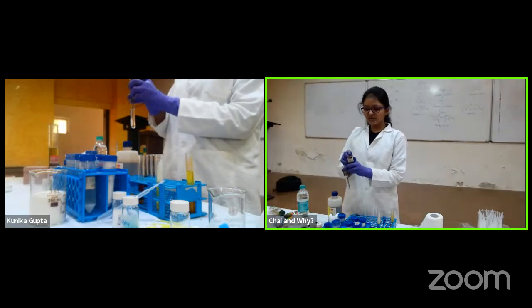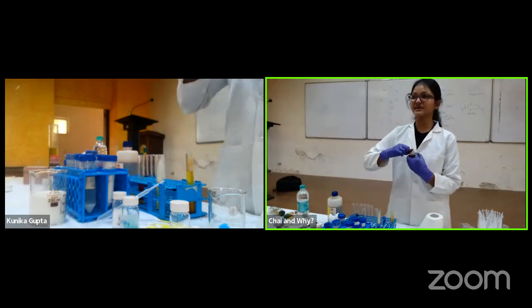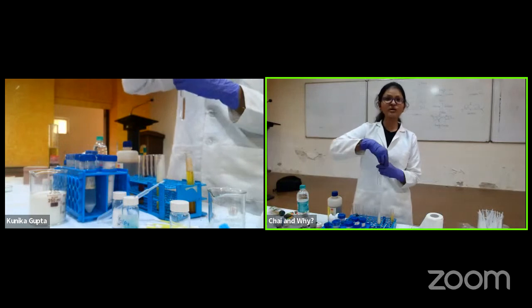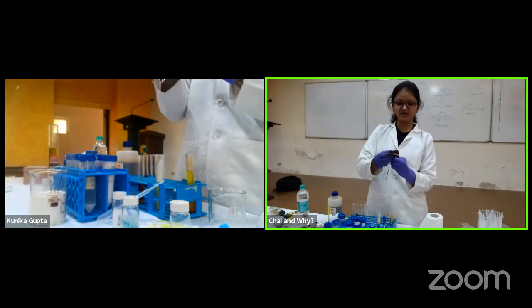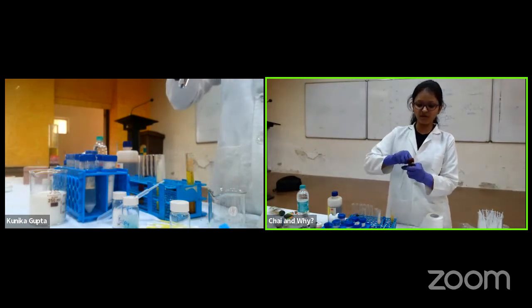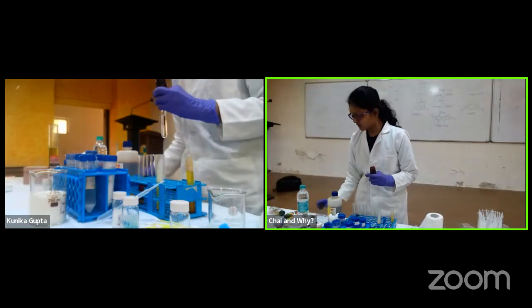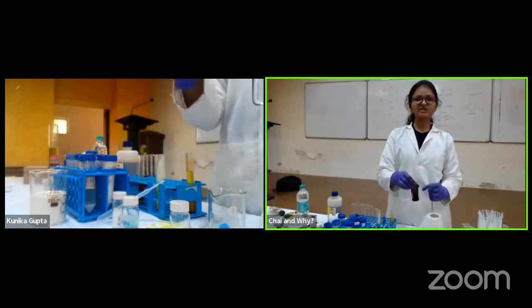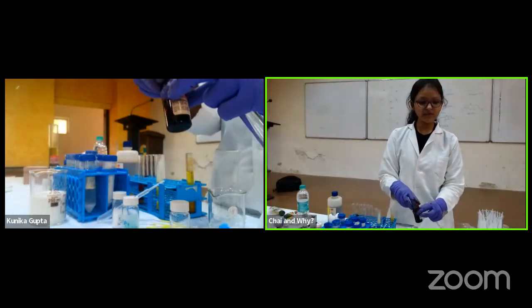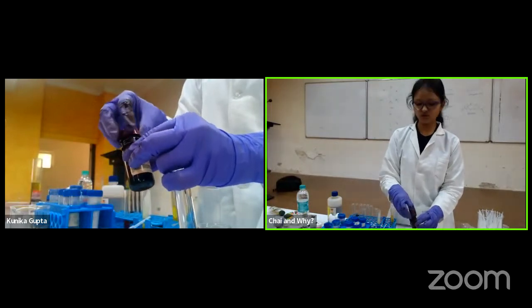Okay. And this is not how we actually deal with it in the lab. So whatever I am showing you here is a demonstration. Don't think this is how we work in the lab. All these chemicals are to be taken under nitrogen. Because what is the use of closing it like this? If I open it, air will come in. Right? When I am opening, it is actually gaining moisture. So what we do in our lab is we open such bottles in a nitrogen atmosphere. Why nitrogen? Because nitrogen does not react. It's a very stable gas. Okay, so we do it under that.